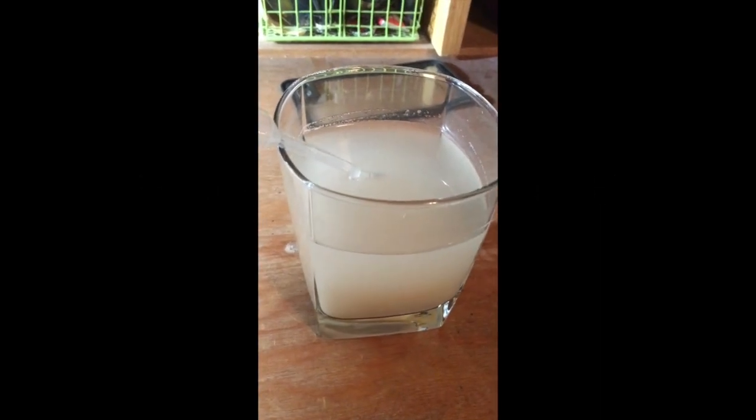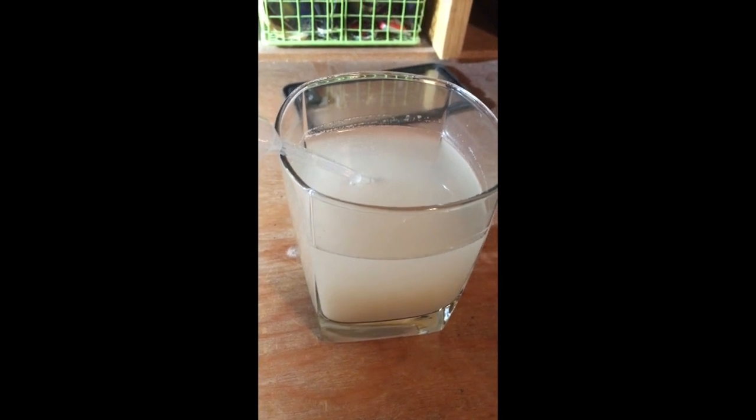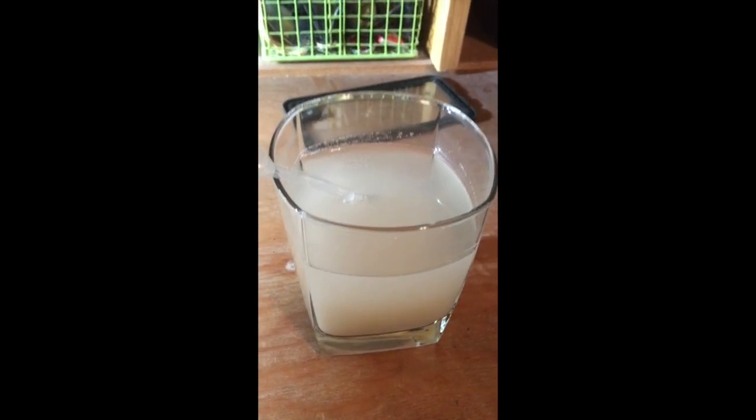This is a glass of yeast. I dissolved it in warm water, and this is what it looks like in the microscope.